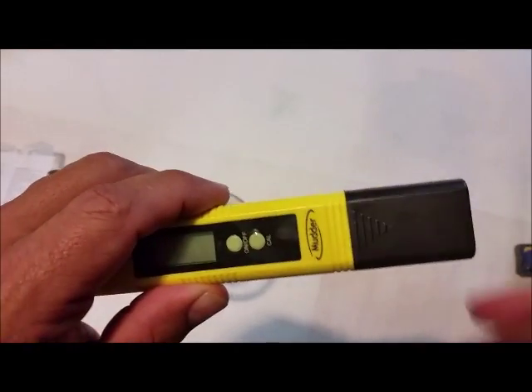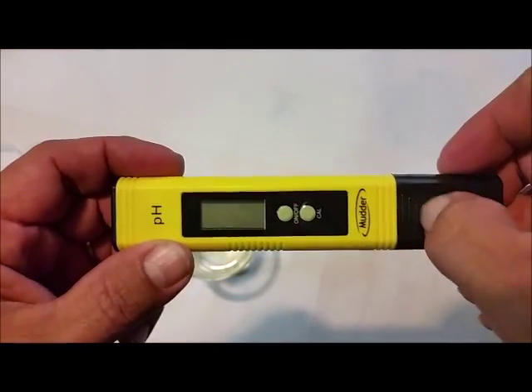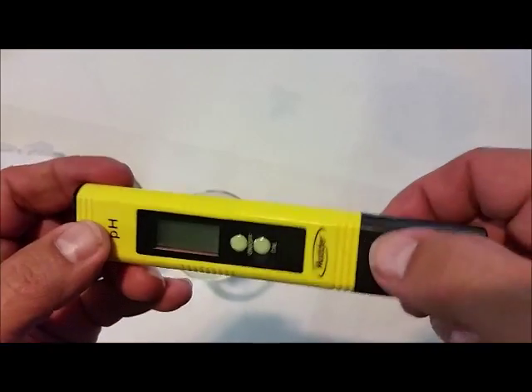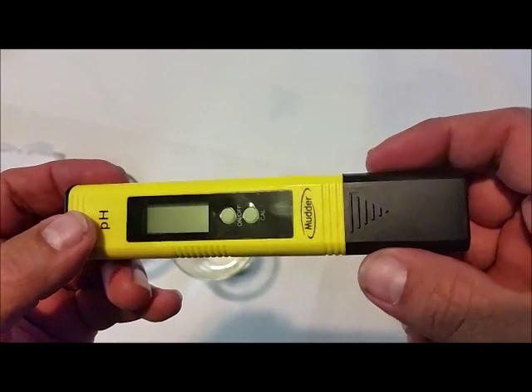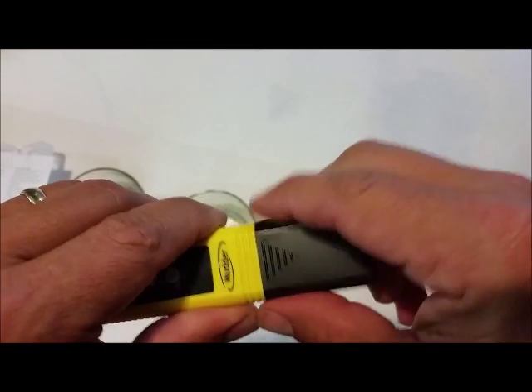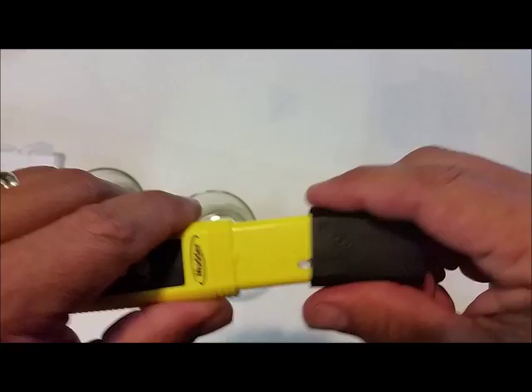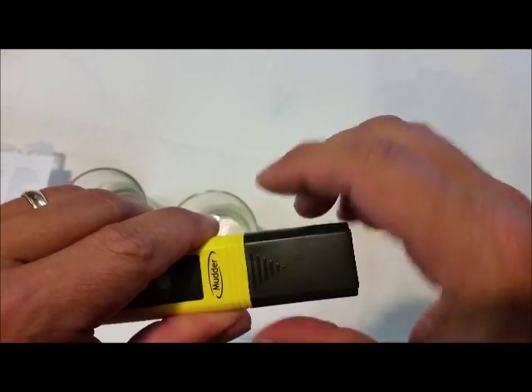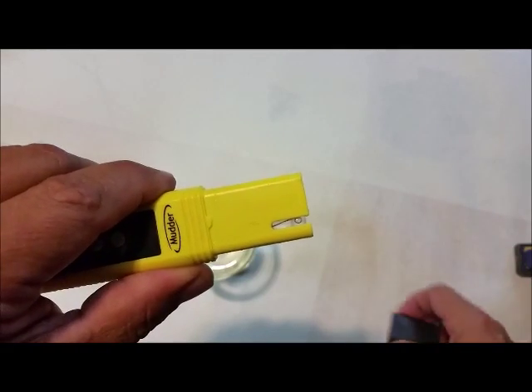I'm going to show you opening this thing up. Grab this test unit. See how it has the grips right here? Don't grab those and pinch and pull because it's just not going to work. If you grab these and pull, it's going to be tough. Grab the sides and pull it off. It comes off real easy. Grab the edges here, not here. Grab it here, pull it off. Simple.